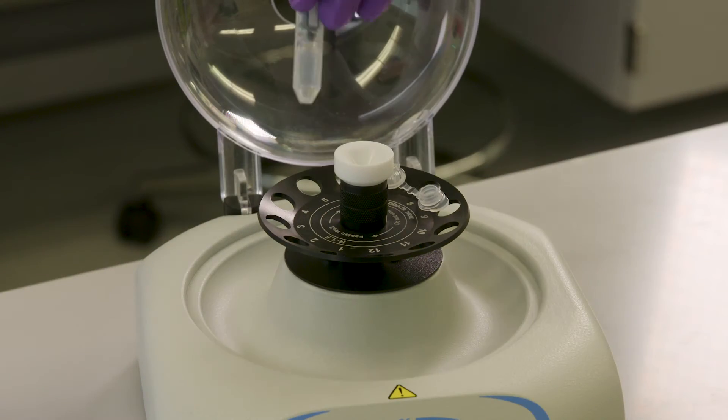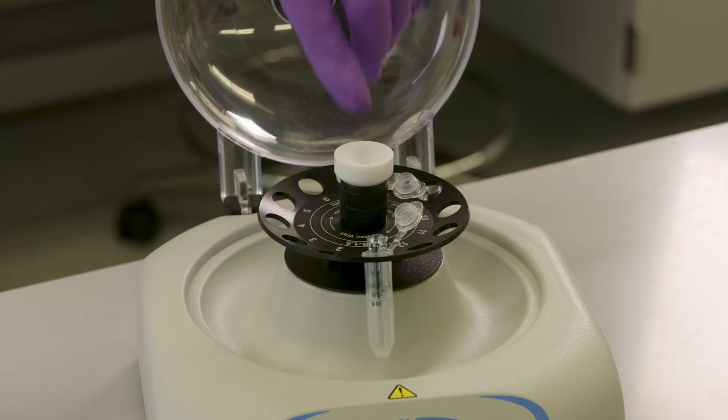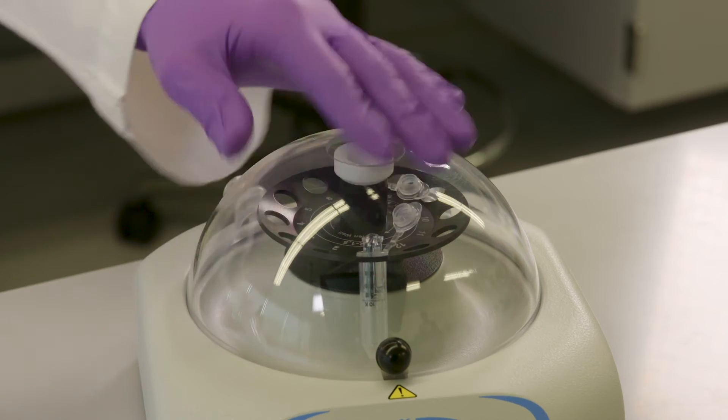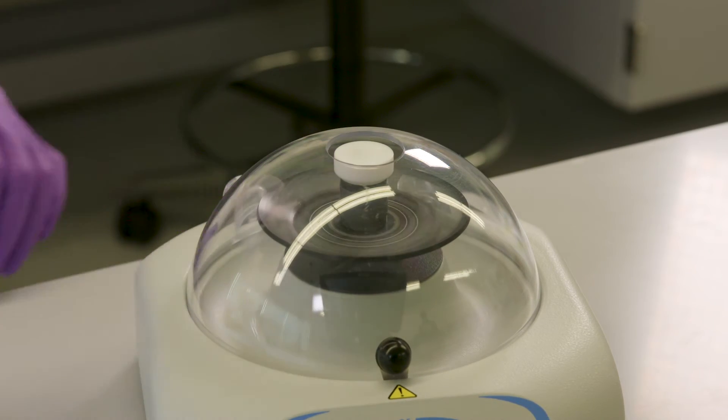This technique is primarily designed for small concentrators where the sample is concentrated to less than 50 microliters or where it is difficult to recover the concentrated sample. Some devices don't need a reverse spin.